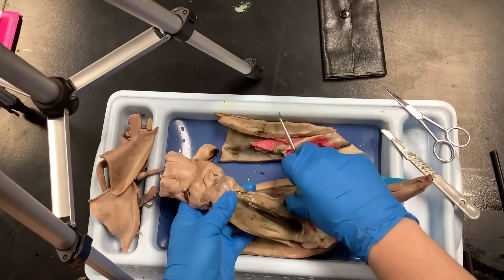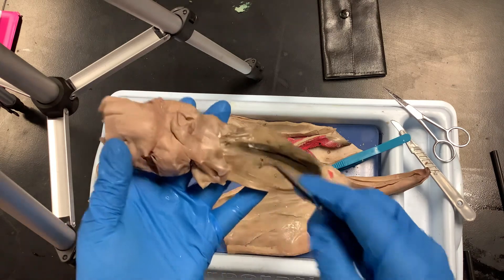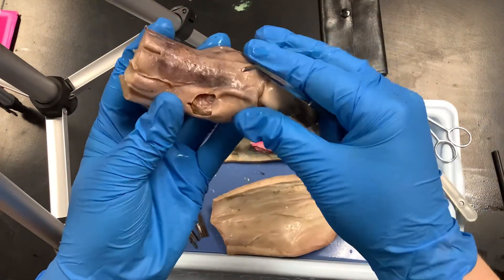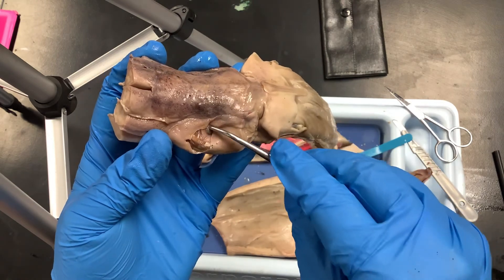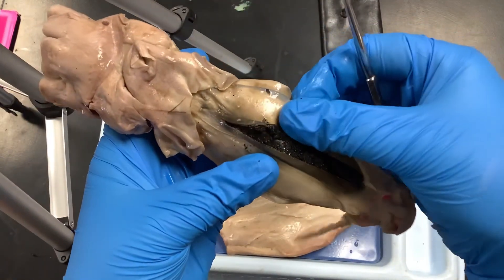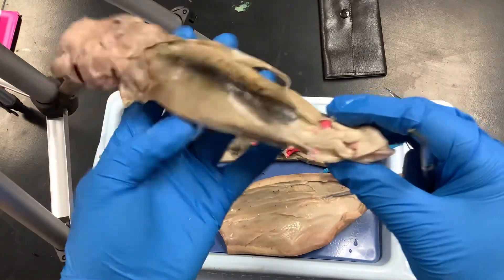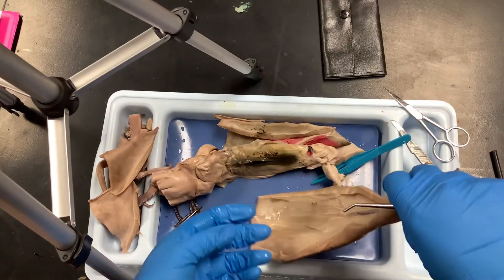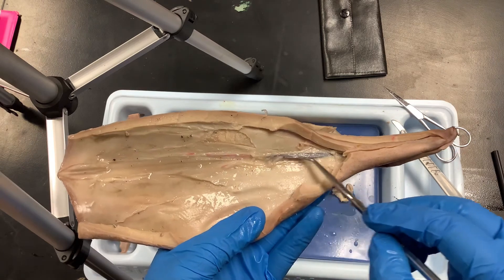The beak is very sharp, which it has to be because the squid uses it to crush smaller clams and maybe even smaller squids. Here's an eyeball, and here's the second one — these don't usually survive very well during preservation. The majority of this tissue is liver. All the organs — gill heart and the rest — are up further near the top of the head. Here's where the pen was, and you can see it extends all the way up with a piece I didn't even get out.